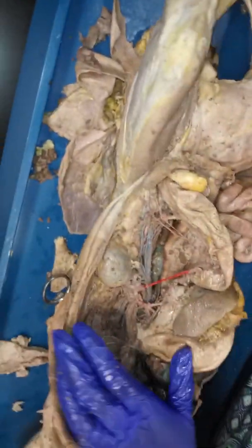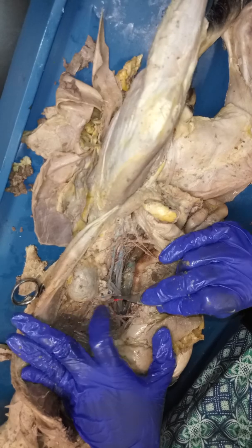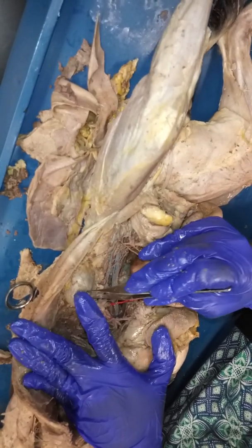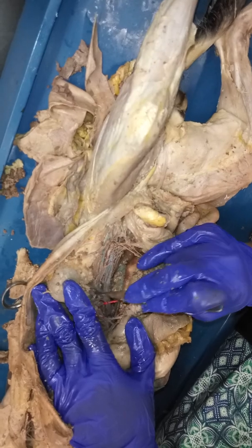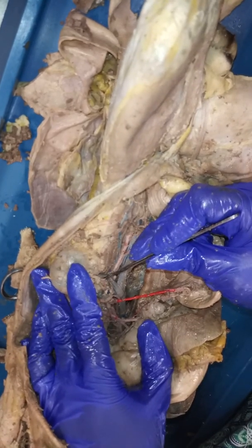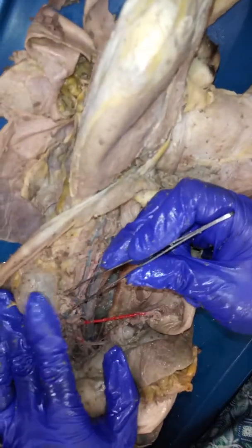Okay, let's go a little further down. All right, so we'll sort of zoom in a little bit. We're going to continue with that abdominal aorta until finally we get to about this point. This is the kidney. So this one over here is the left kidney, just to give you an idea. And then you're going to notice that there is one artery, and it's not staining very well, but we can still see it. If you notice that there is this one artery right about here, the artery is typically going to be smaller than the renal vein, but this is the renal artery, and the renal artery is going to take blood to the kidney.